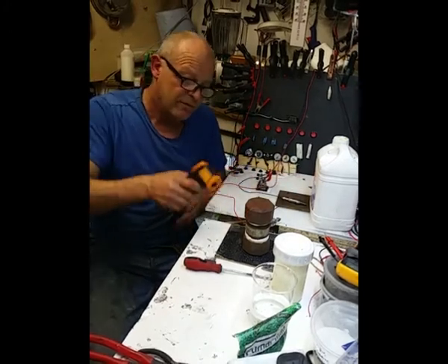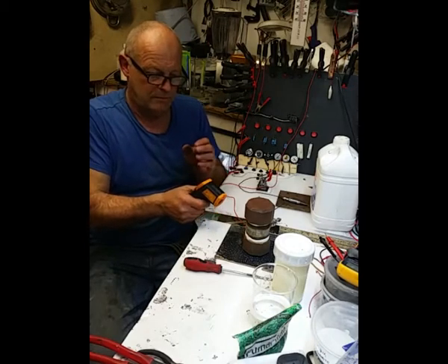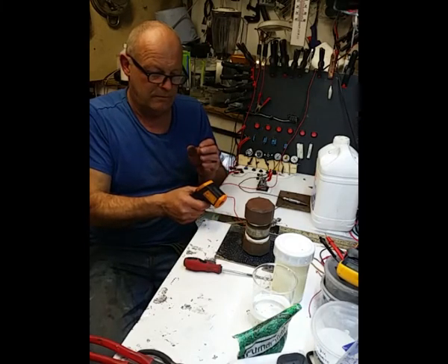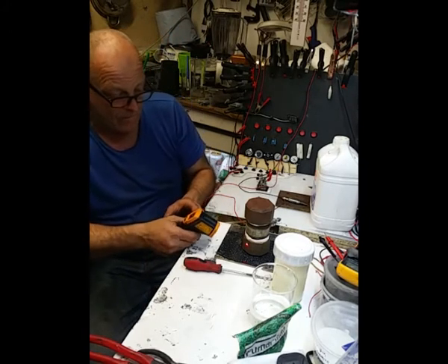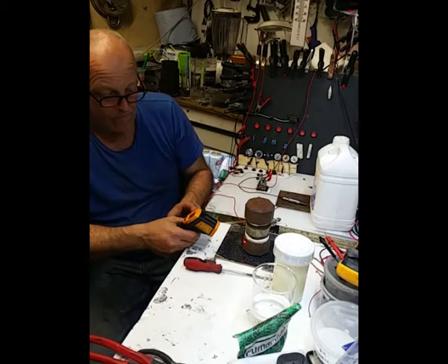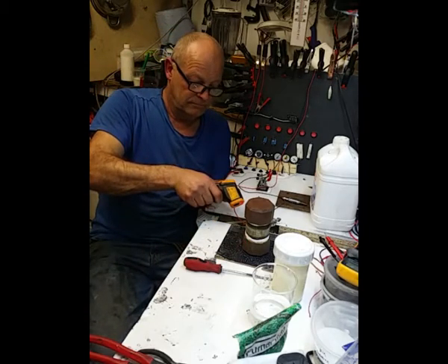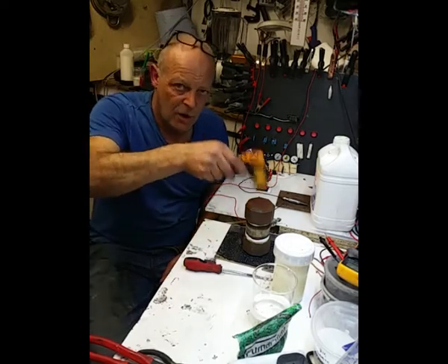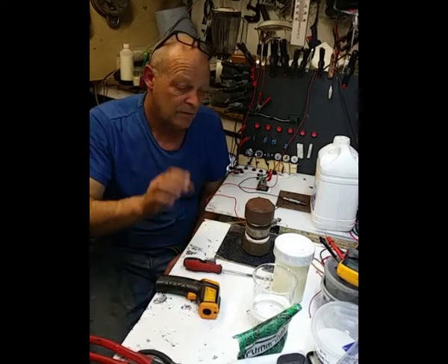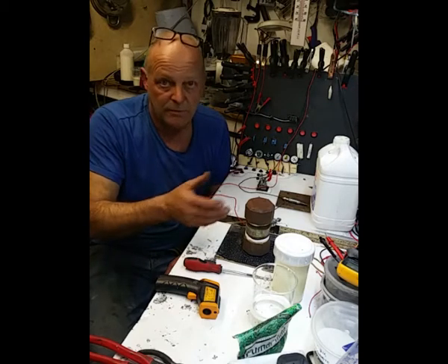It seems uniform around the top. And it seems uniform in the middle. And it's uniform on the base, but there is some variation. It's obviously hot on the top. So what I'll do is I'll just leave that for a while, and come back to it.